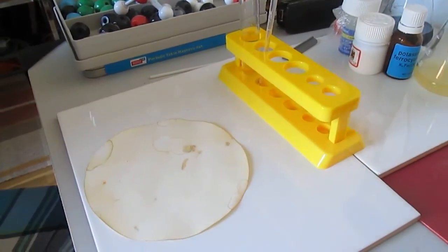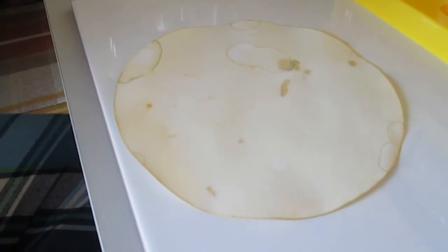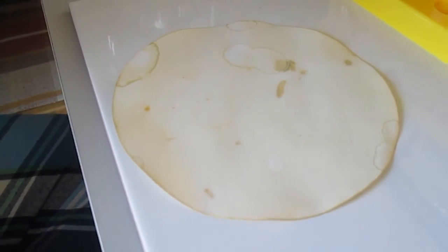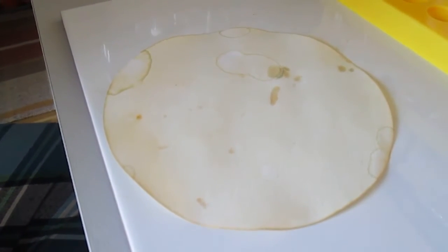For the final part of our experiment, I have soaked a sheet of filter paper with ammonium iron sulfate solution and left it to dry in the sun.